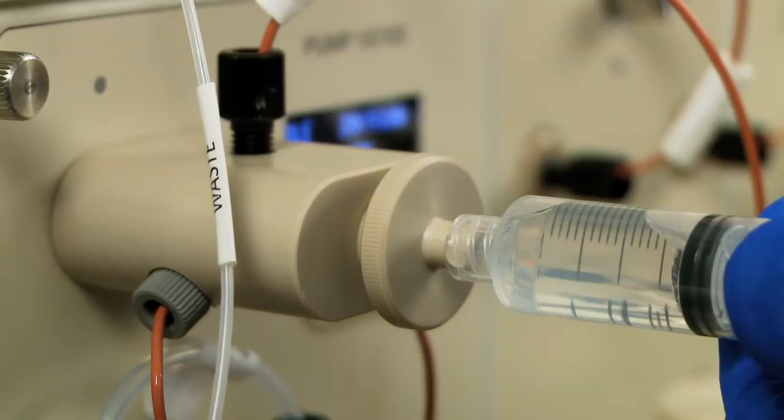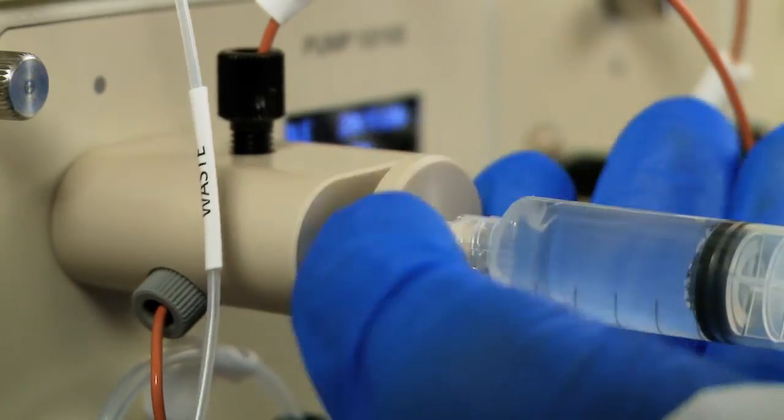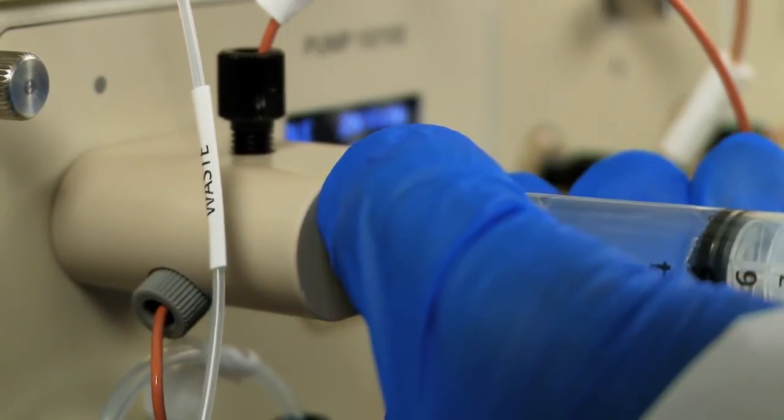Close the port by turning it clockwise. Be careful not to push air back into the pump while closing it. Finally, detach the syringe.